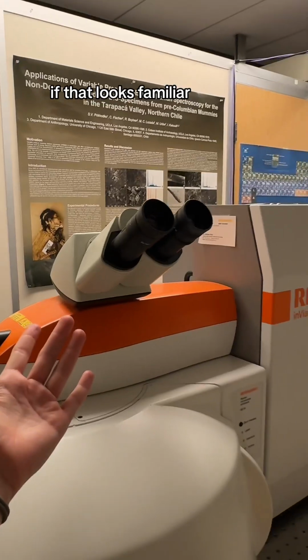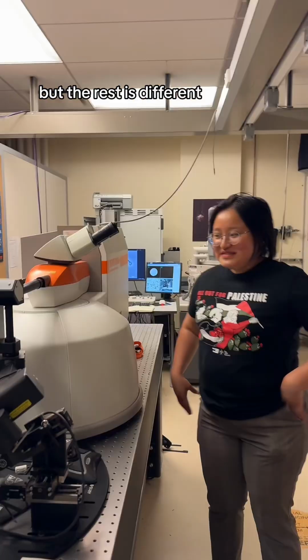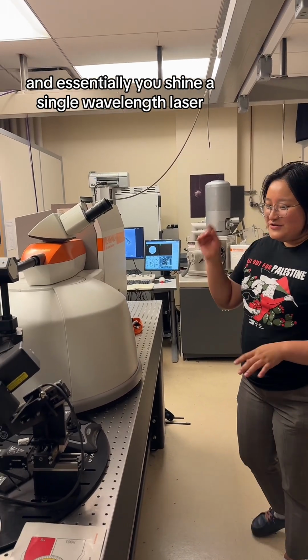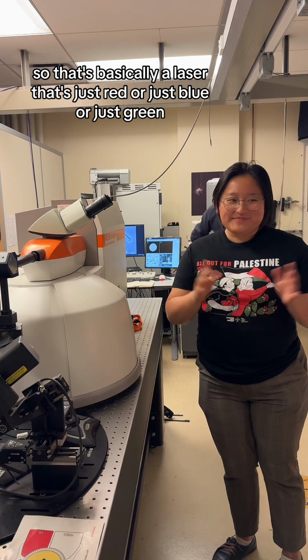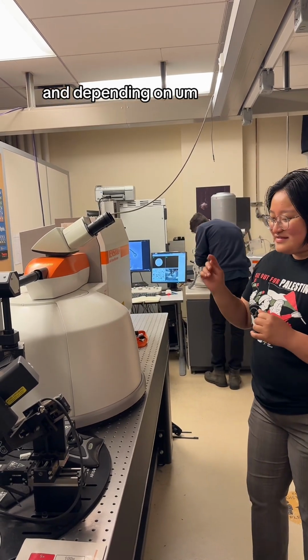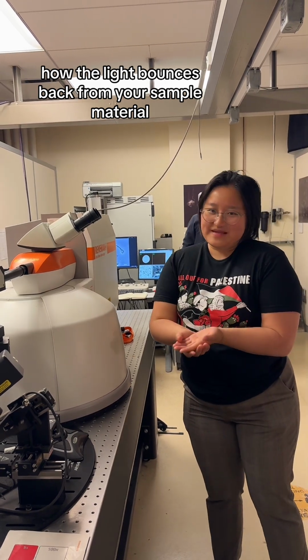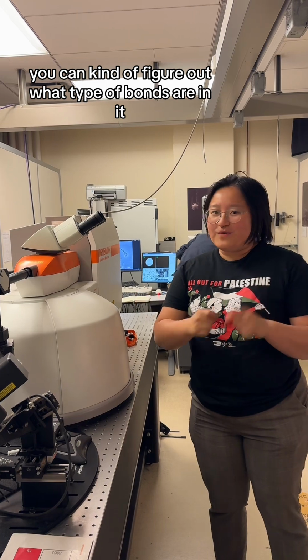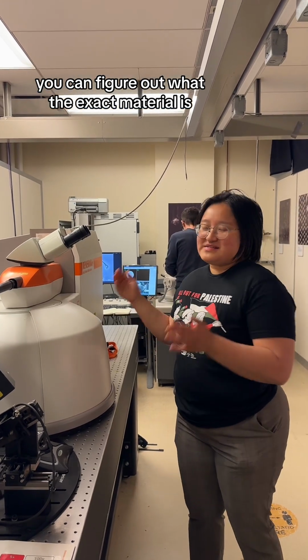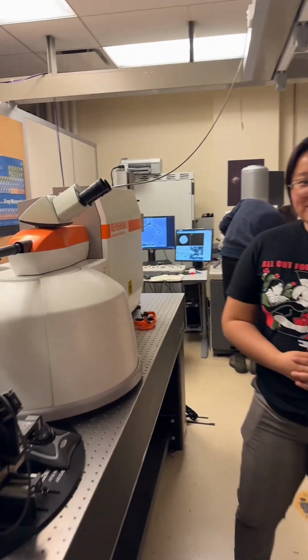If that looks familiar, it's because it's the same eyepiece as you'd use in an optical microscope, but the rest is different. Alright, so this is a Raman microscope, and essentially you shine a single wavelength laser. That's basically a laser that's just red or just blue or just green, and depending on how the light bounces back from your sample material, you can figure out what type of bonds are in it. And from figuring out what type of bonds are in it, you can figure out what the exact material is. So it acts like a fingerprint for different materials.